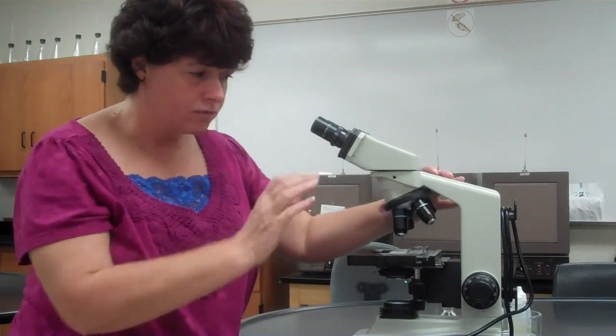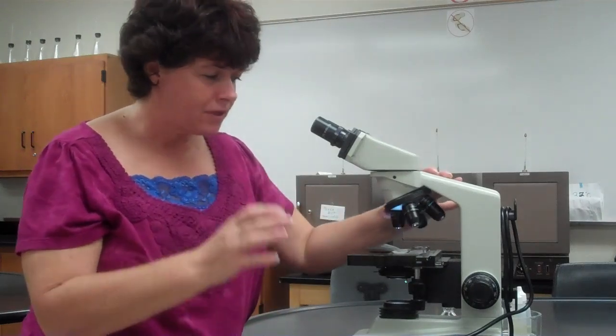So now you've done all the right things. You have it under the 100. It's good and focused. You can find it. It's really important that you don't give up on this, okay? You need to make sure that you can find the correct specimen. You're going to see a lot of stuff on there. You may see big blobs of stain.